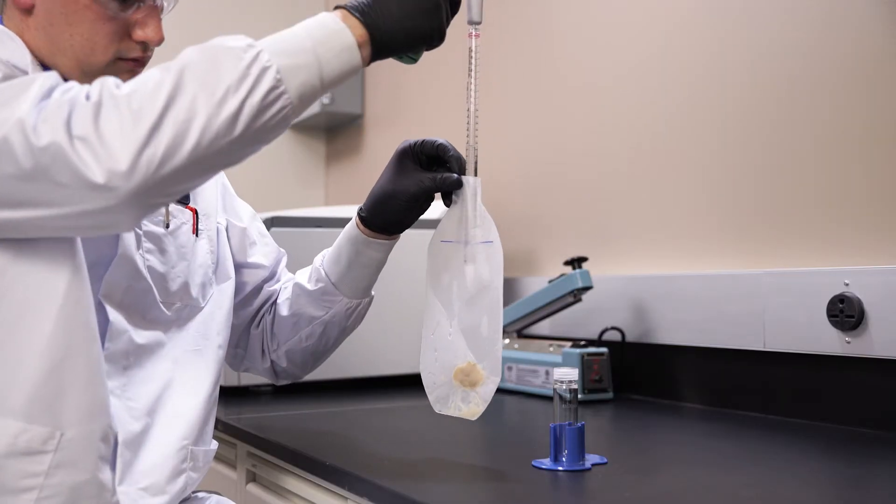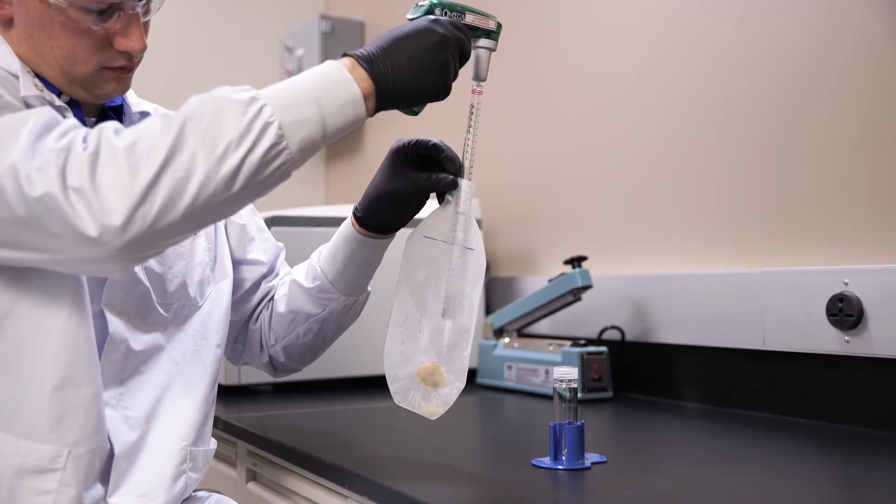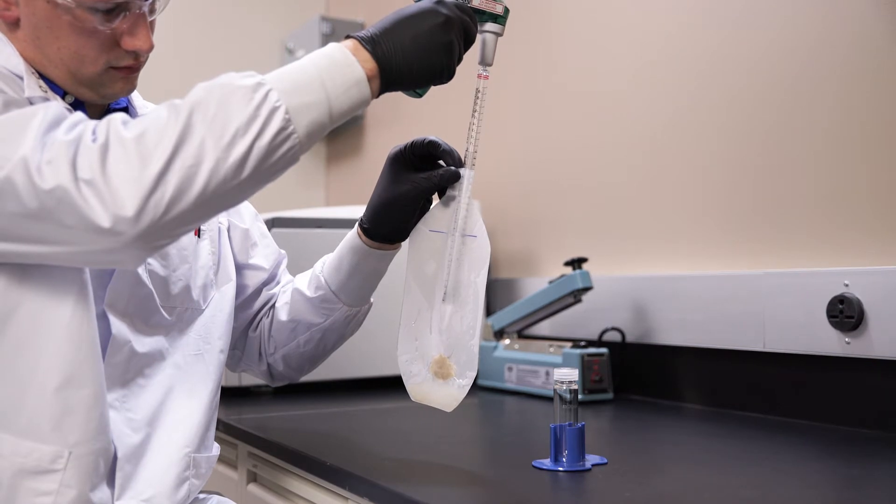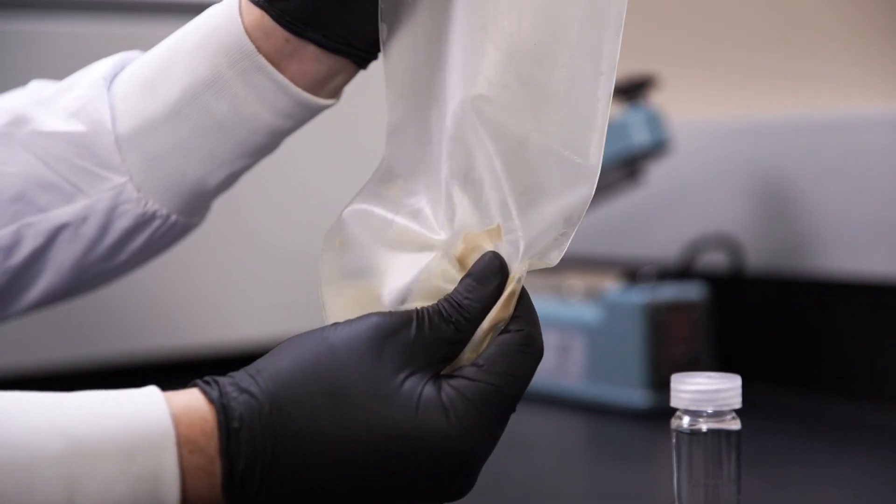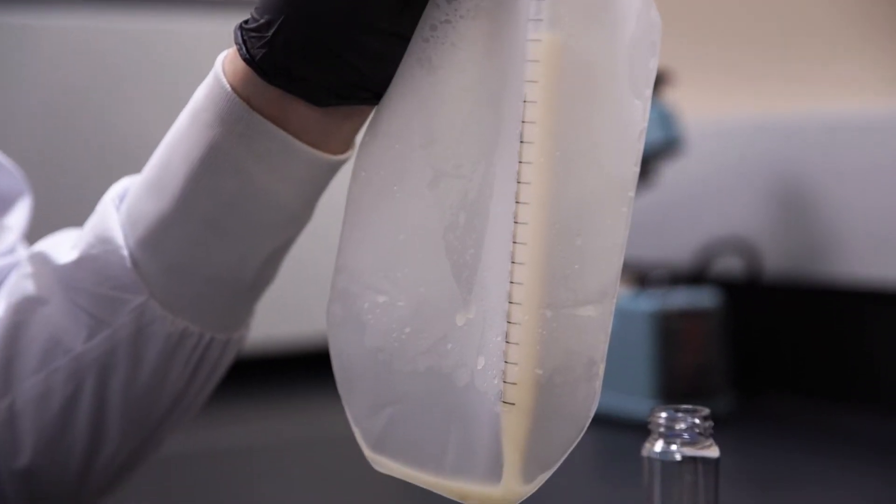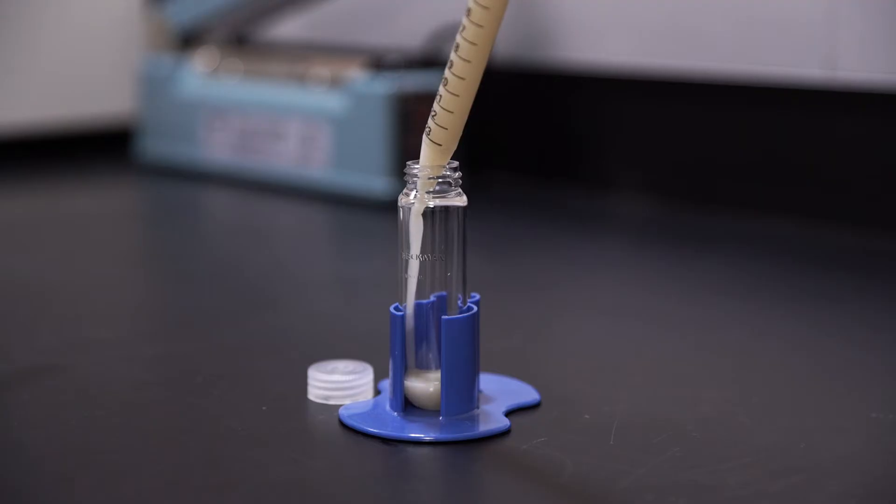The pellet can also be re-suspended in solution within the liner. Begin by pipetting in re-suspension or lysis buffer and physically massage the pellet to quickly aid re-suspension. The re-suspended pellet can then be directly transferred to a new vessel or heat-sealed in the liner and set aside.